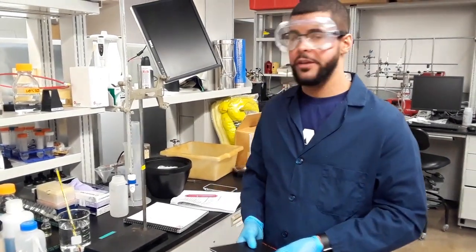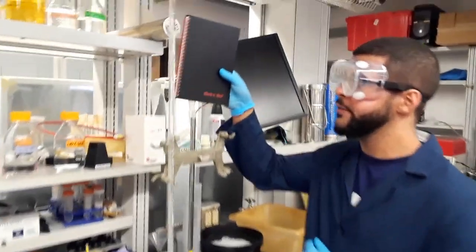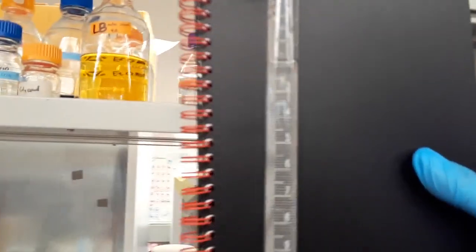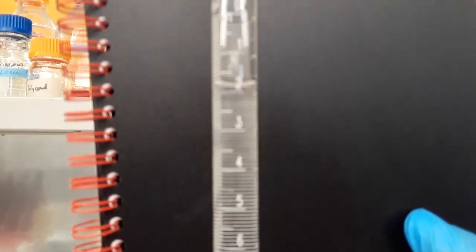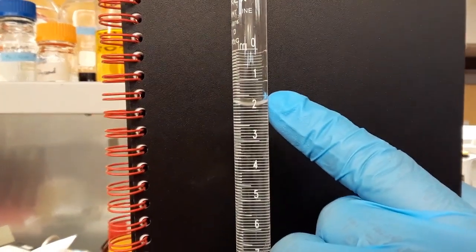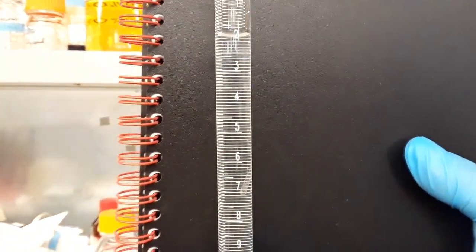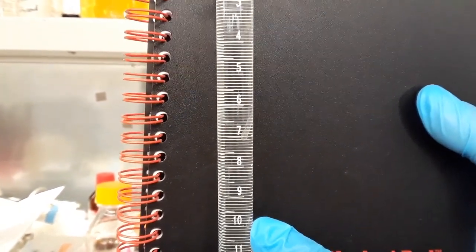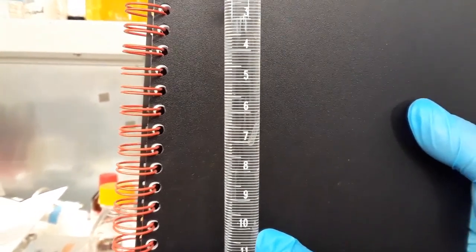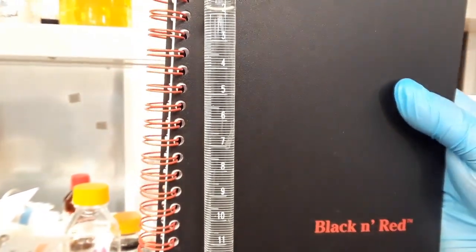So we are going to use a 50 milliliter glass burette. If you come here and look at how the burette measures, it goes from top to bottom. So the most accurate way of measuring how much water we are dispensing is to write down the starting volume of water that is listed, then dispense the amount of water that you want and subtract the starting volume from your final volume that is listed. And that is the most accurate way of measuring how much water you dispensed.